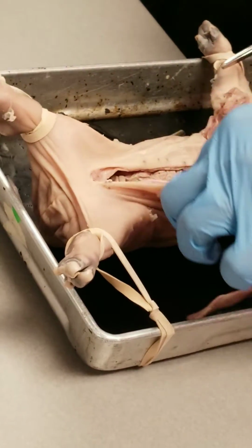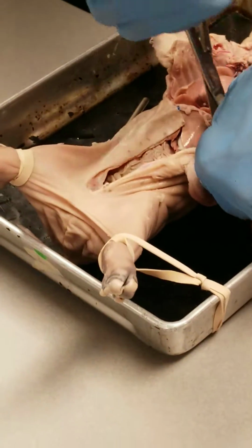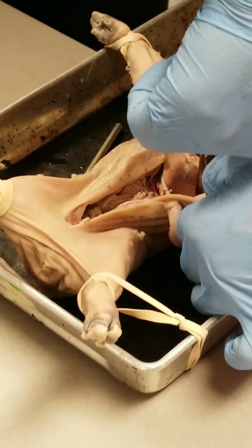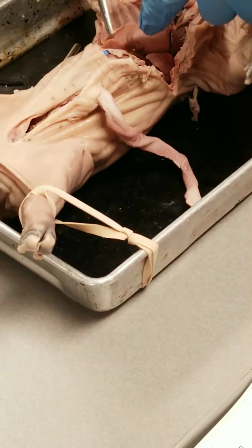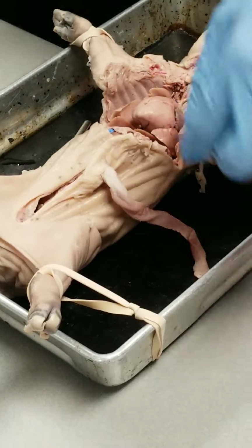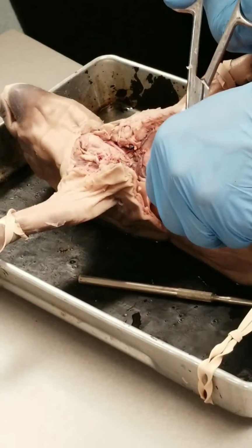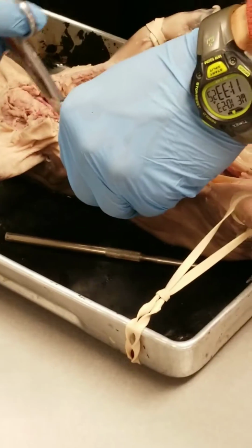To really get into the cavity, though, what you're going to need to do, if you haven't done so already, is cut the diaphragm away from the body wall. So cut that diaphragm away from the body wall. I try to keep it so that it's generally in its natural position. That way you know that that's the diaphragm. You can see the delineation between the thoracic cavity, that's cranial to it, and the abdominal pelvic cavity caudal to it. Continue to do the same, cut along the body wall.